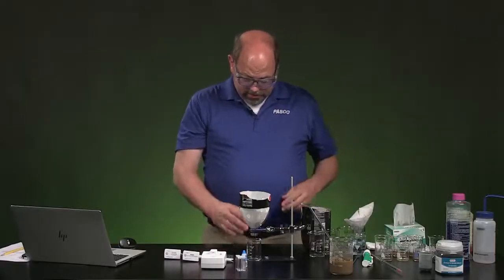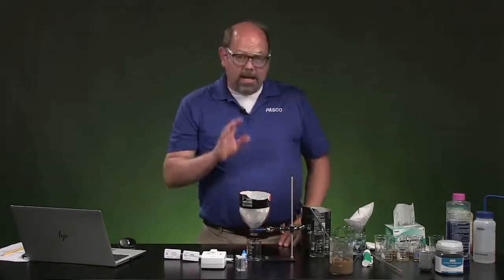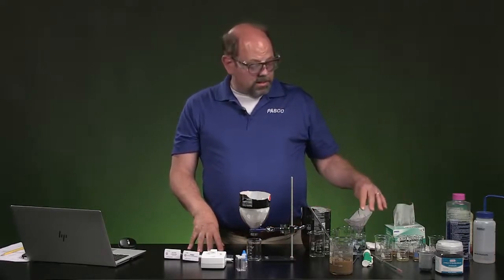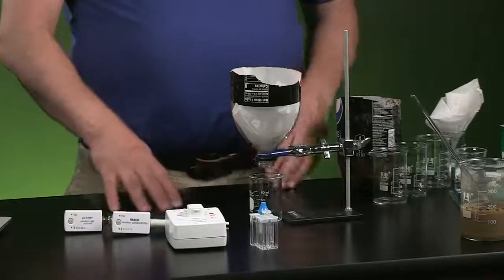Now that may take a little bit of time because first it has to get wet, then it'll wet the sides, and then it'll work its way down to the bottom. I know that's going to take some time, so when I come back and we go through the data gathering and analysis, I will have done that, and I'll take our little samples here that have already filtered through that process.